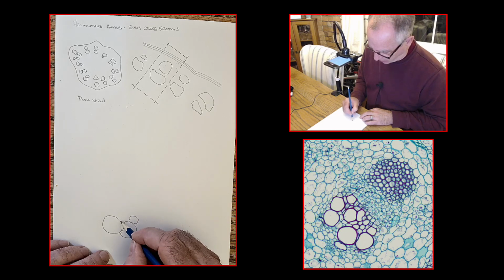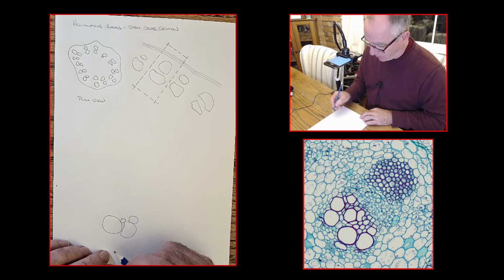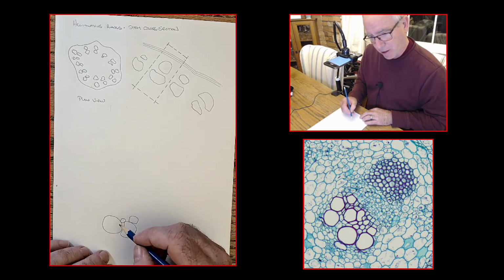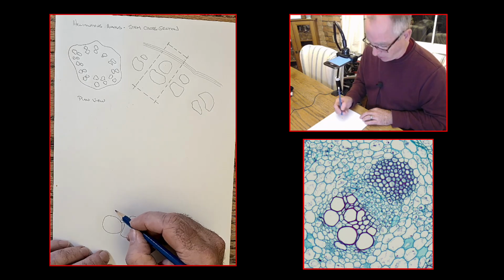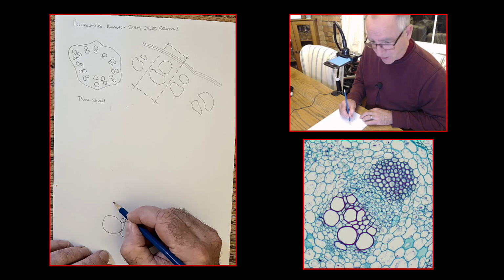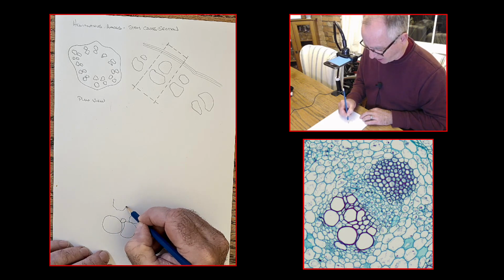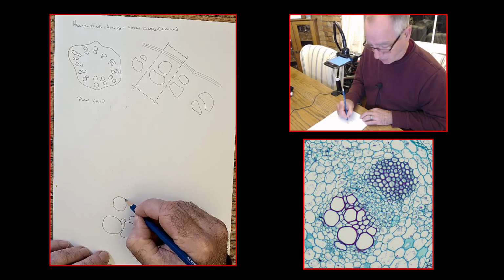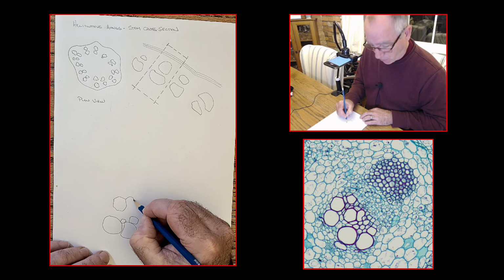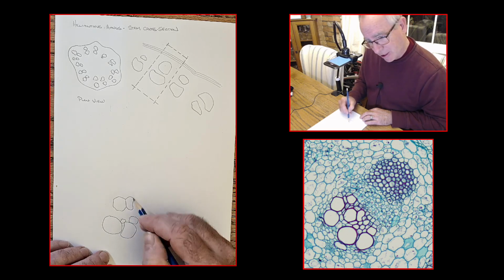You can see that there are some tiny cells that are down in the corners here like this. So you take your time doing that sort of thing. What I'm going to want to do here, just to speed the video along, is to draw the whole series of cells going towards the outside. So there will be a couple more of these big xylem cells. This one here is almost octagonal if you take a look at it. It goes something like this. Not very good, John, but it'll have to do. And then this one here has a little bit of a wiggle in it like that. And they fit together quite nicely up against this side here.